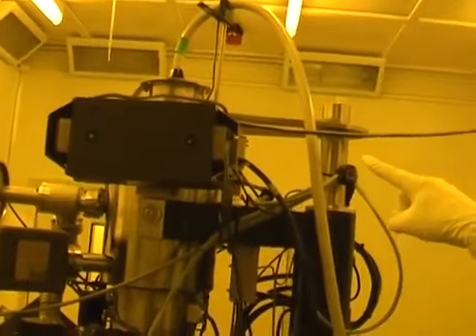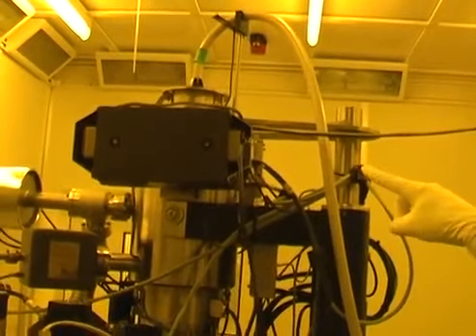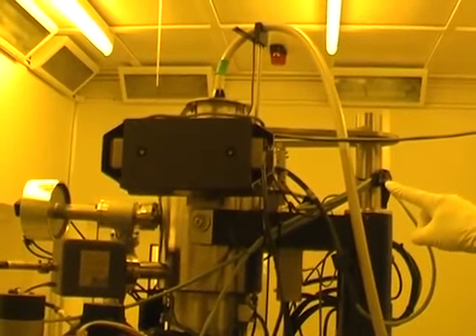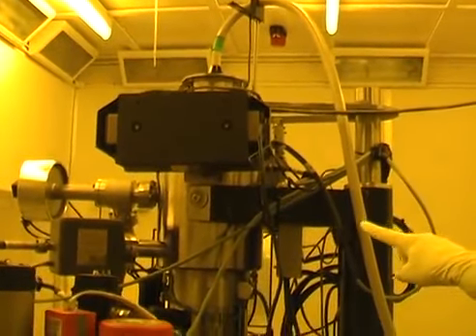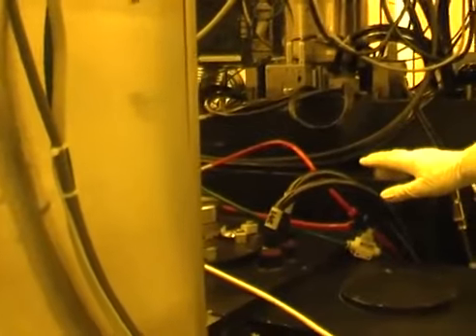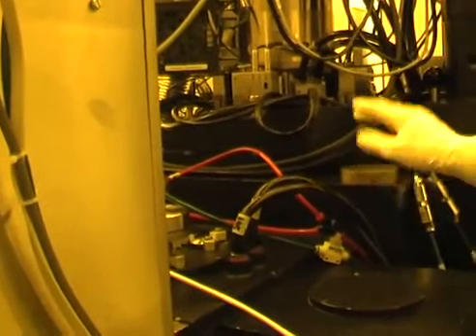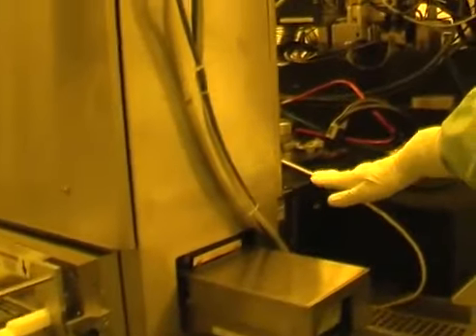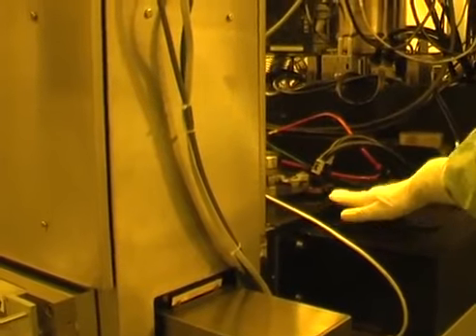And at the top there, just below the cable, is the field emission gun where the electrons start, and they work their way through the column down to the stage area, which is at the same height as the loading bay we saw earlier. So when the holder is loaded, it just comes through a central robot area to the stage, which is here, directly underneath the beam.